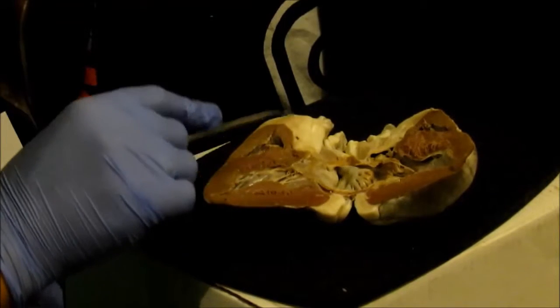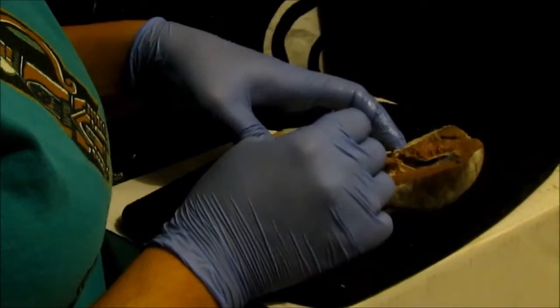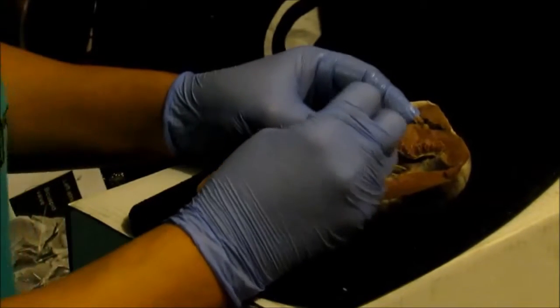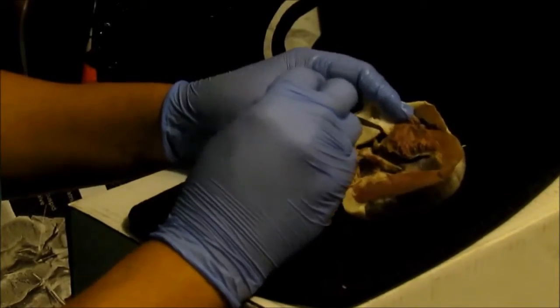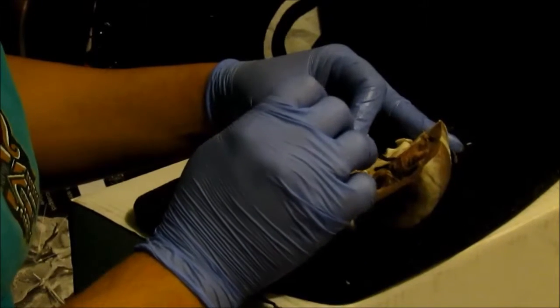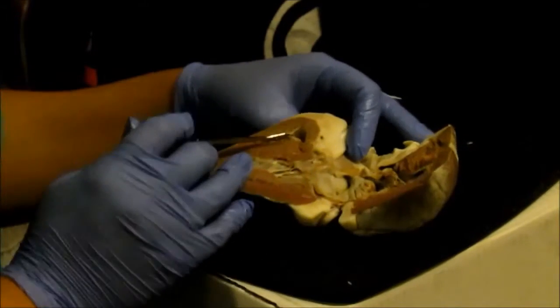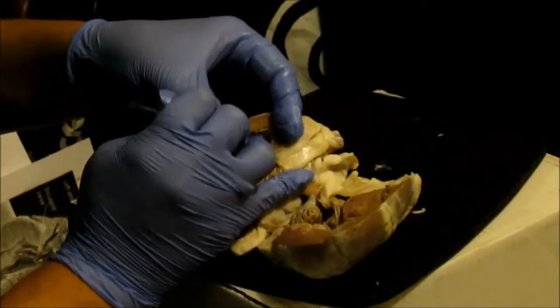The bicuspid mitral, or the left AV valve, that is going to be located right here. This is the bicuspid valve. Actually, this would be the aortic semilunar valve right here. And then this is it right here. I think I cut into it. It'd be right here. So you've got the bicuspid and the semilunar valve. The tricuspid is coming back over here. The tricuspid is in here, and it has 3 cusps.